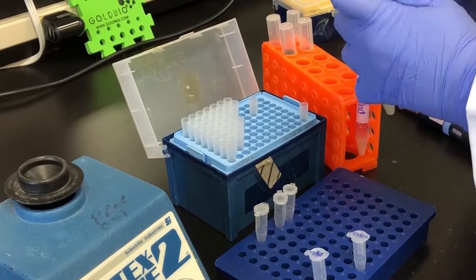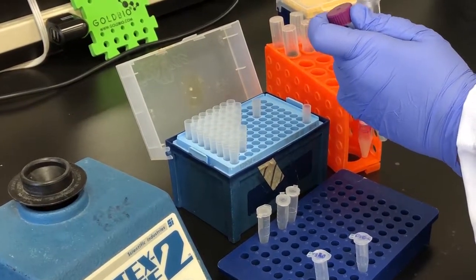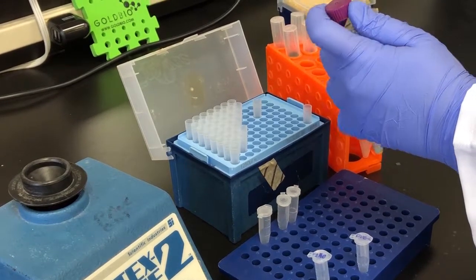After the 60 minute incubation period I lightly vortexed the solution one more time and transferred the solution to Eppendorf tubes.